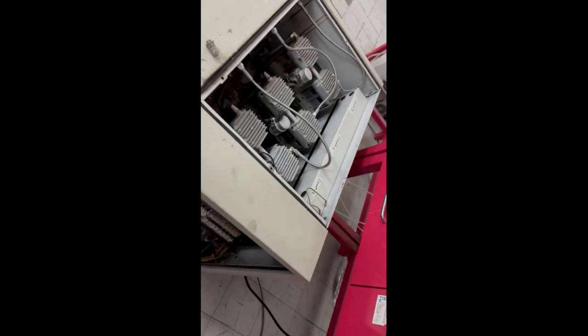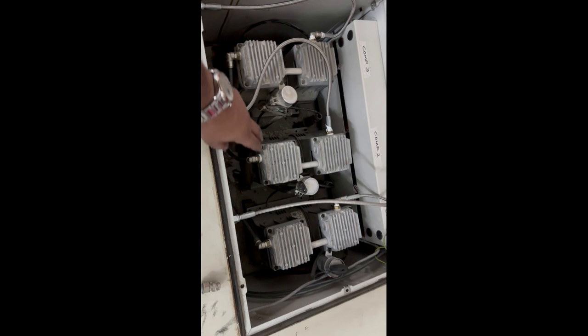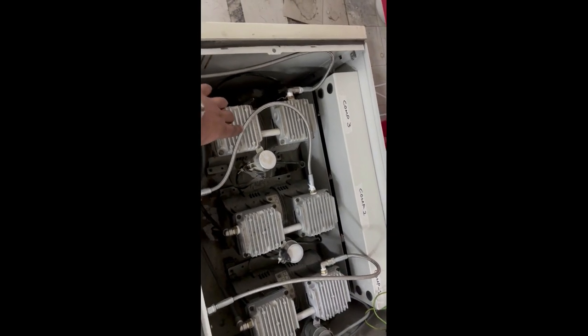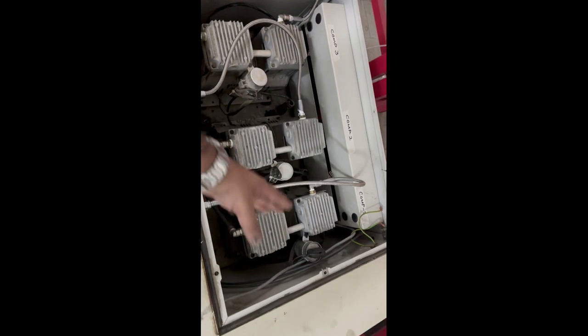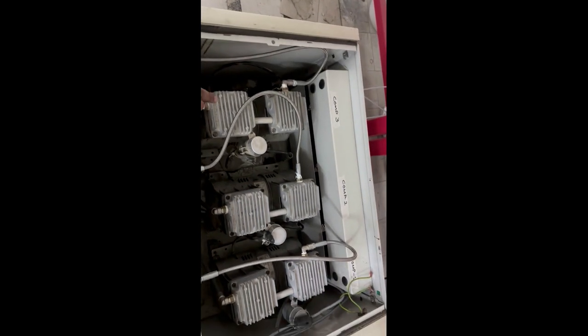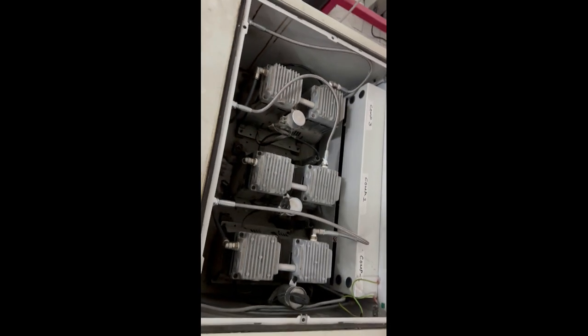Since we have 3 compressors: compressor 1 is for nitrogen, compressor 2 is for nitrogen and air. So this is for both, because it has a valve located under here. It switches to send the pressure either to the membrane or to the tank. And the third one is for redundancy mode, meaning if either of your systems is not working or any compressor goes out of service, this will take over the operation and work in replacement of any faulty compressor.